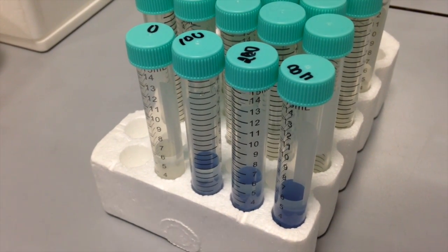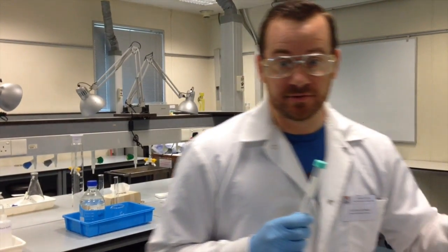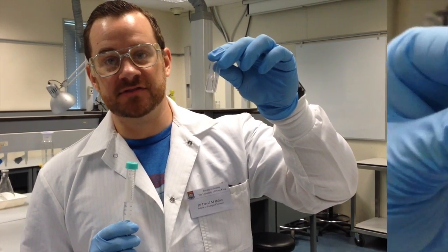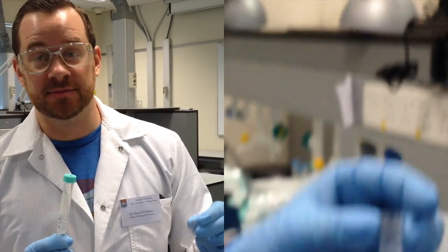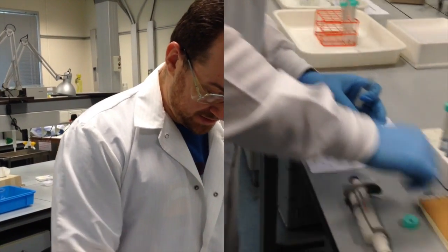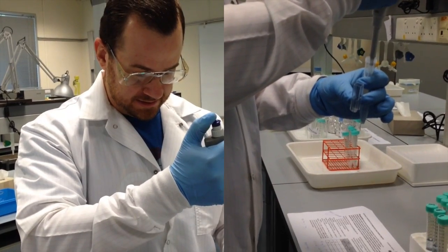After our reaction has been completed, I'm going to transfer 2 milliliters of each of my standards and my sample into one of these disposable cuvettes. The cuvette can hold about 2 milliliters of solution, and it has special markings that will help you to orient its position inside the spectrophotometer. But first I need to add 2 milliliters to my cuvette, and I can do that by holding them both in one hand.